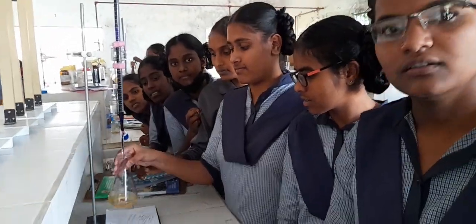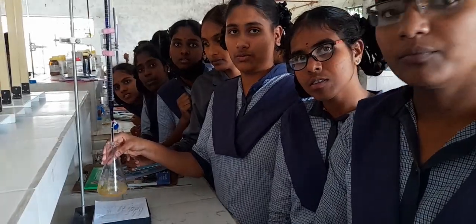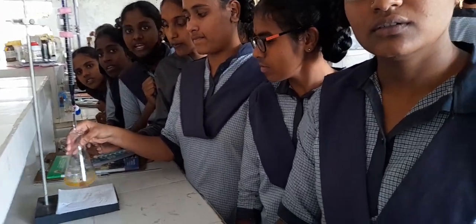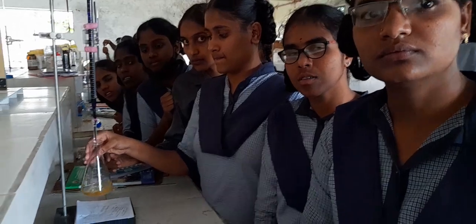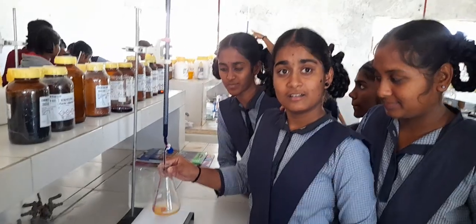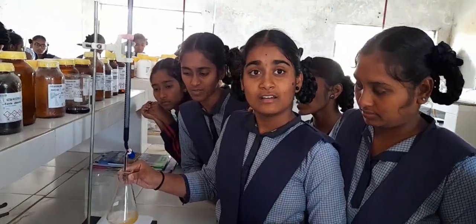Second one. Okay. What is your first reading? 21.2. Okay. You are also very close. So do one more reading, Nana. Till the pink point, you will be noting down your readings. Okay. So we will be moving to our calculation part. So here we have Lahari and group with their set of practical. So let's interact with them.